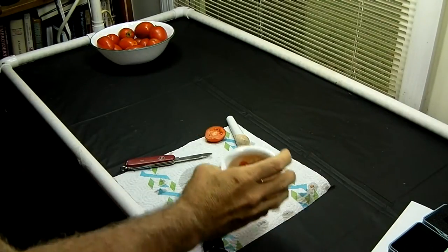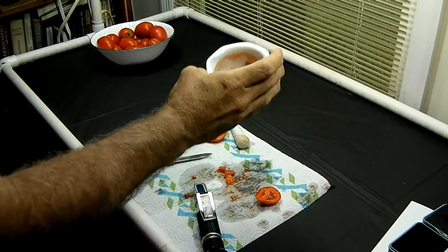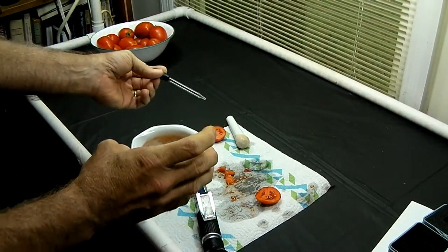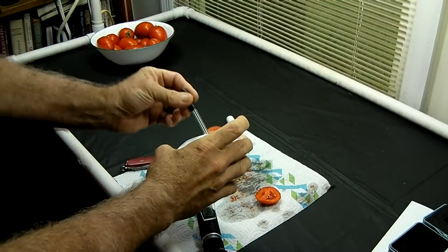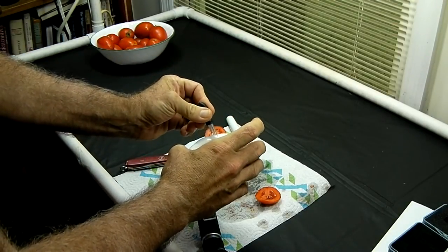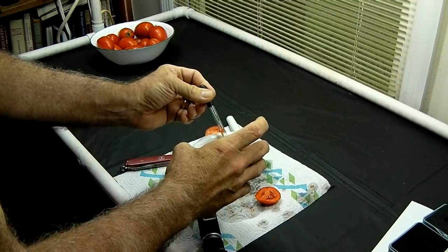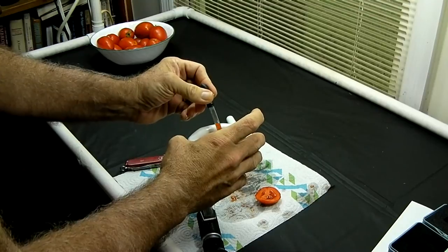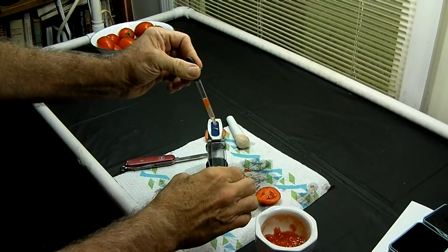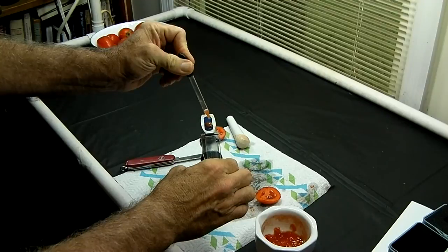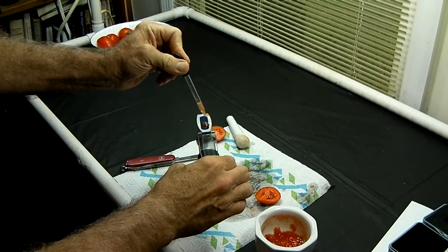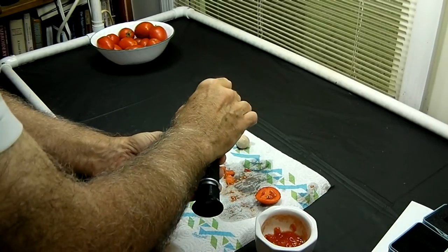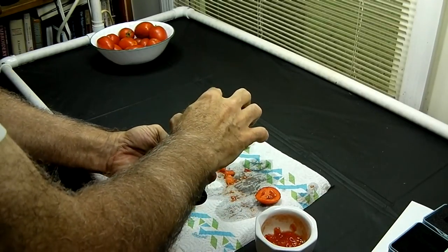Now I've completely crushed that up and made a paste out of it, and I'm going to use a glass eyedropper instead of that plastic pipette because those things are kind of hard to clean. So I'm going to take a bit of the juice out of there and make sure you don't get seeds and stuff. There we go, that's probably enough. I'll put that on there, I've got one seed and we'll just push that off the side. All right, I'll put that shield down, press it down.